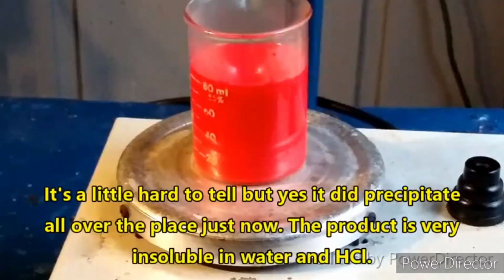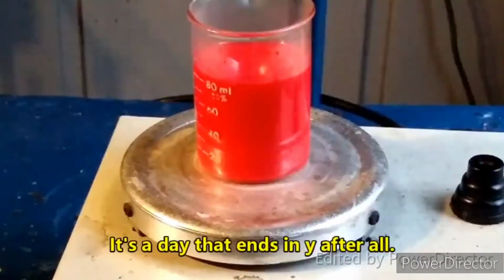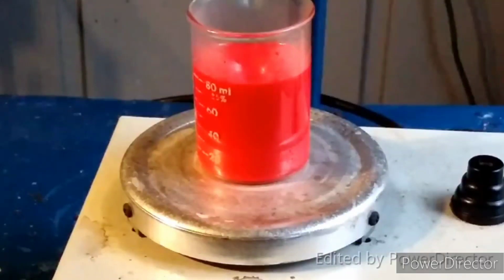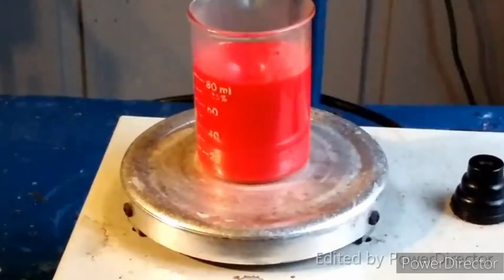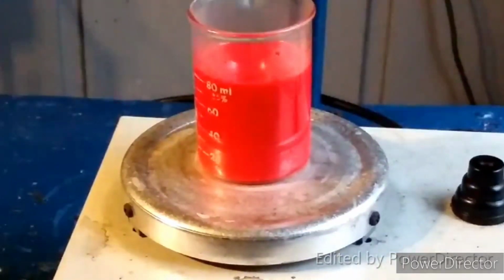There we go. You can see it's a very nice color. God, this thing just does not want to focus today. It is more red on camera than it is in real life. In real life, this one turned out a bit more orange than the last one. Whatever. Six of one, half a dozen of another, right? And that's pretty much it. All you would do now is just filter it off and dry it, and you will have cesium pentaiodobismuthate, in theory.